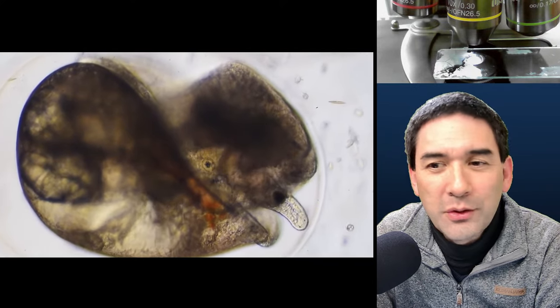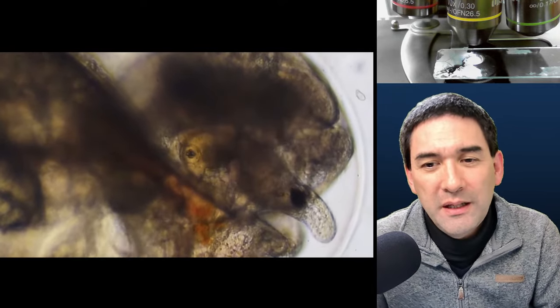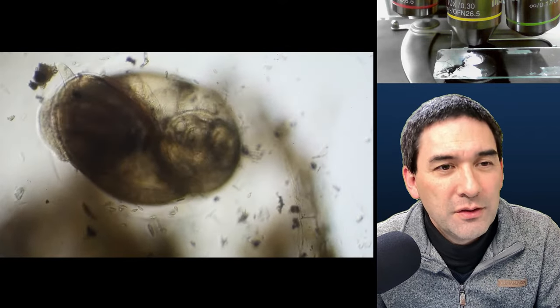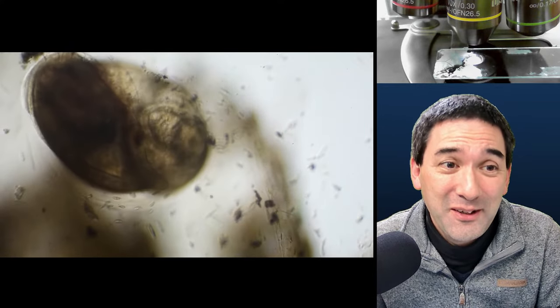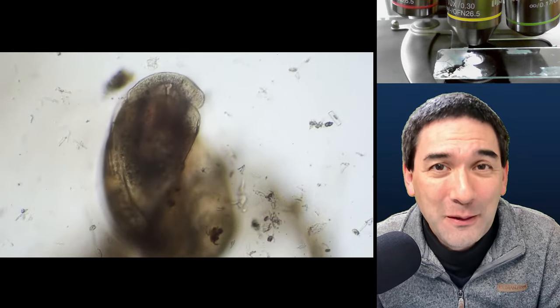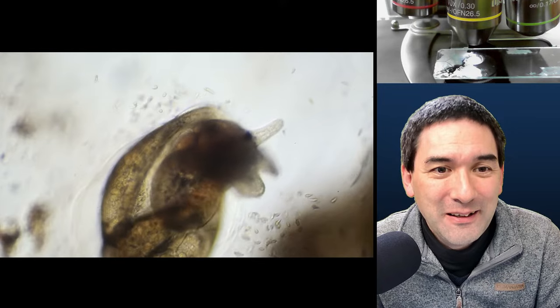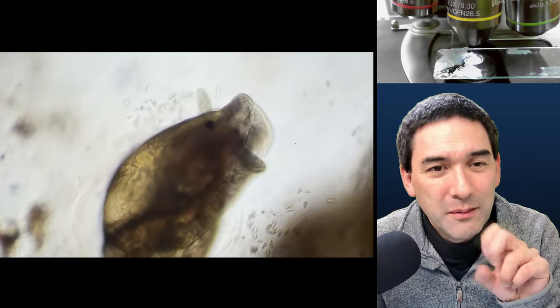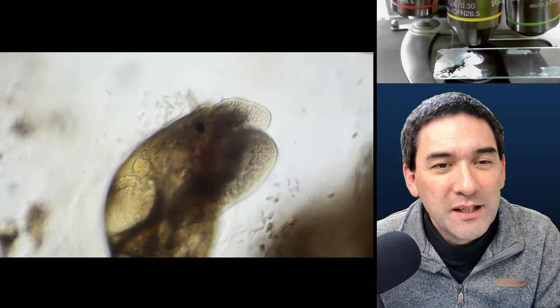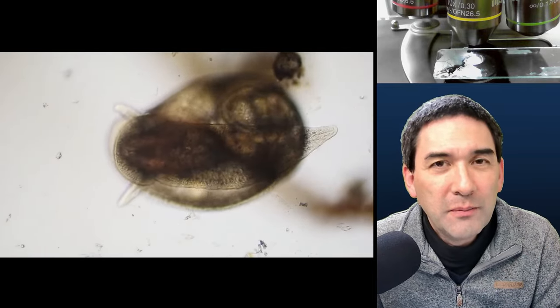More and more detail starts to develop. This is light microscopy at its best — one of the big advantages of a light microscope is that you can see colors, movement, and the actual processes of life. Electron microscopes have other advantages, but you cannot see moving objects in electron microscopes. The snail has a radula — a mouth-like structure used to scrape off surfaces. That's why aquariums use snails to clean algae growing on the glass.